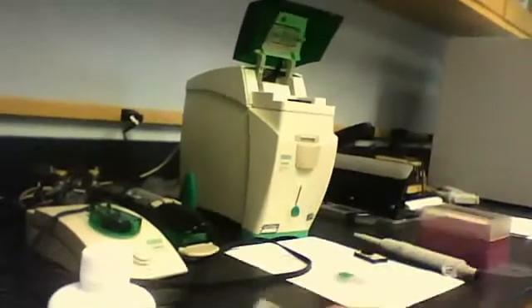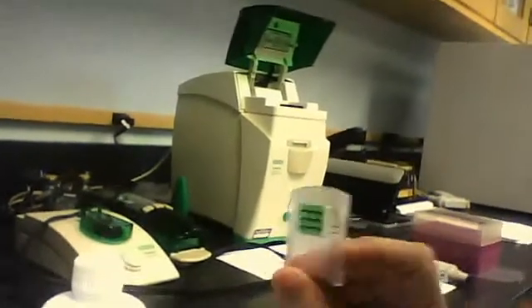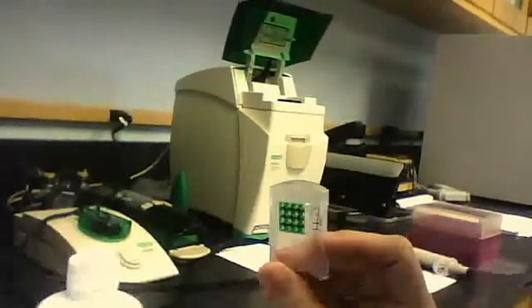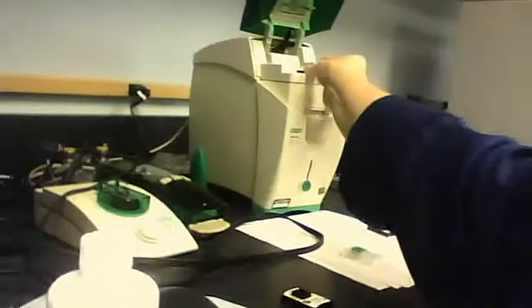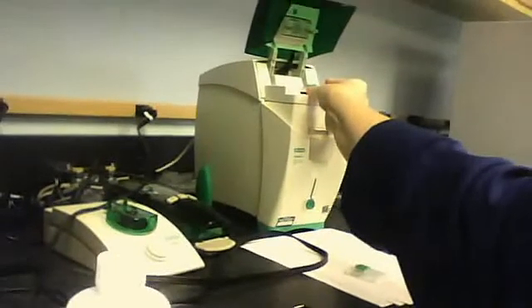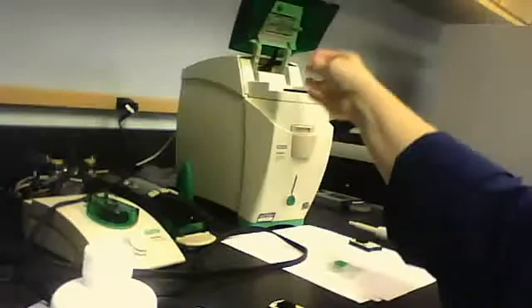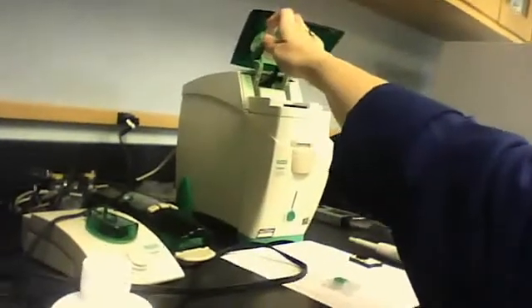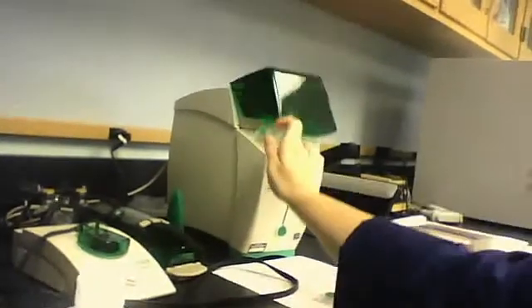Pipette another 800 microliters, put it back into the machine, close it for two more minutes. And then you want to raise the hood like this, raise the machine hood. Leave it sitting up for 60 seconds and then close it. And then you're done cleaning your machine. That is the first part of your process.